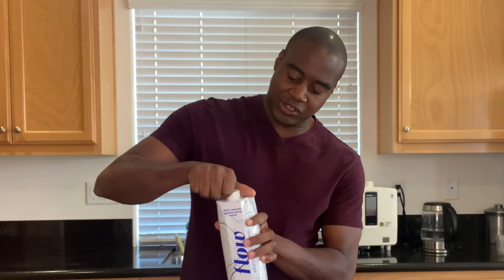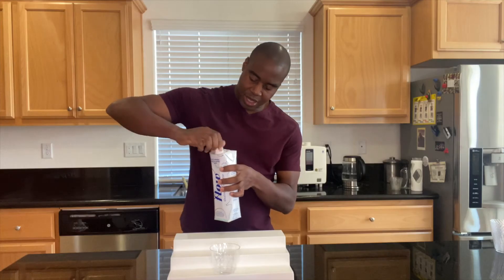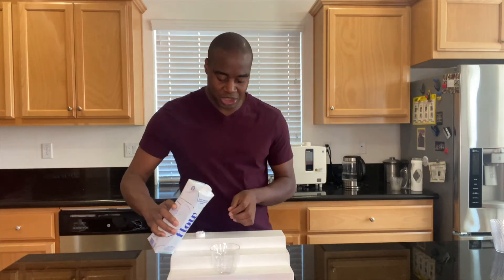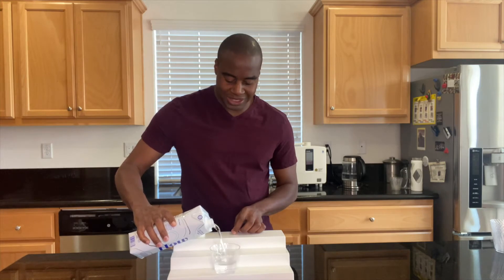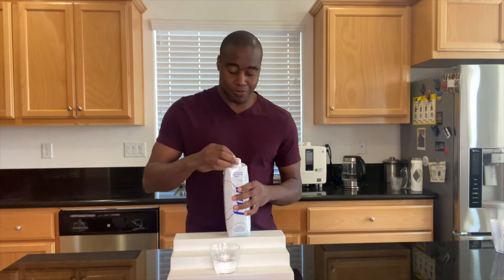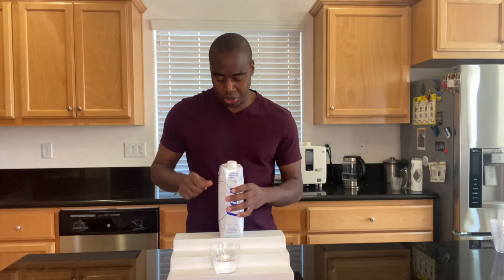Alright, let's go ahead and get this opened up. You guys are looking for a pH, so we'll have these pH drops in there. We get a red, orange, or yellow, that means it's acidic. And if we get a blue, purple, any of those colors is alkaline. Green is neutral.